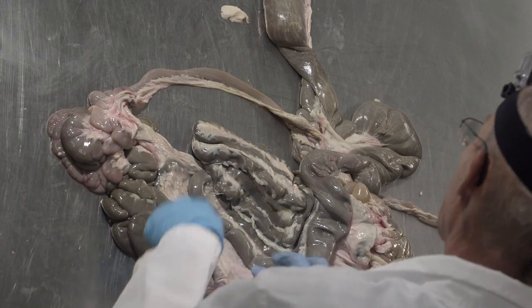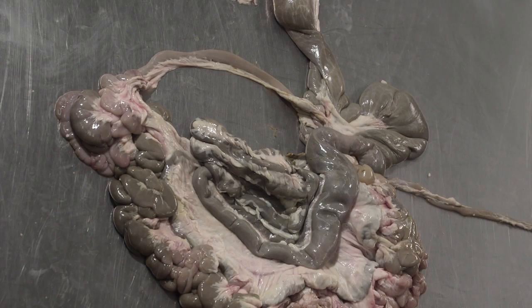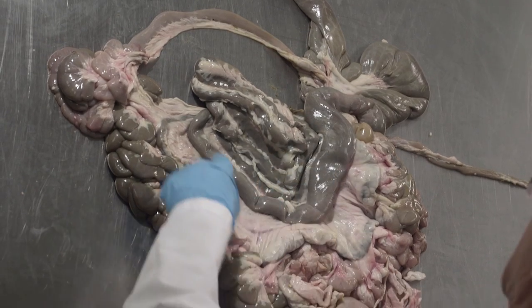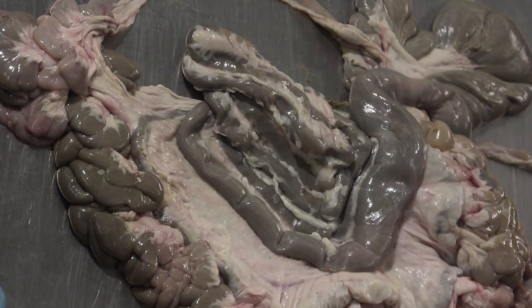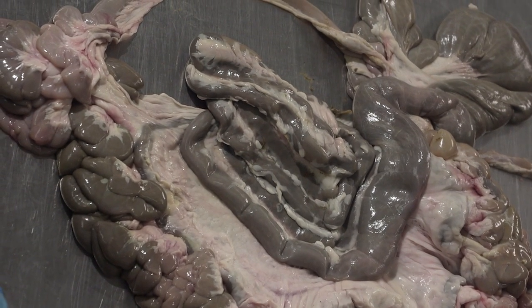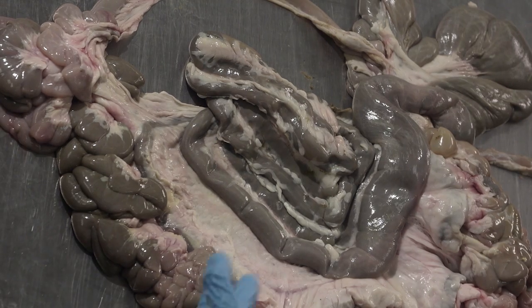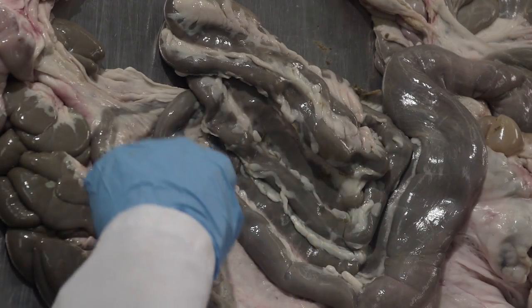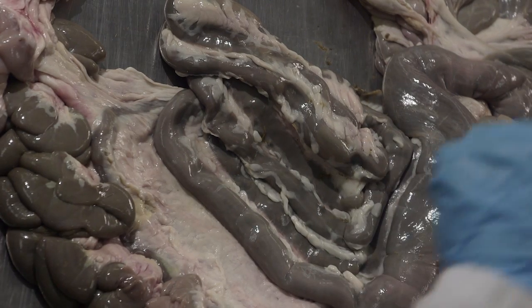And then you can see very nicely in this sheep, and it was actually also present in the pig, it's just we couldn't see it quite so cleanly, you have this sort of spiral portion of the colon that's very characteristic of all artiodactyl animals. Those are animals that have cloven hooves, two toes. So it's true for cattle, sheep, goats, all of our deer species, all the ruminants, but it's also true for pigs. And it's a spiral portion. It's like a hairpin loop that then curls on itself.